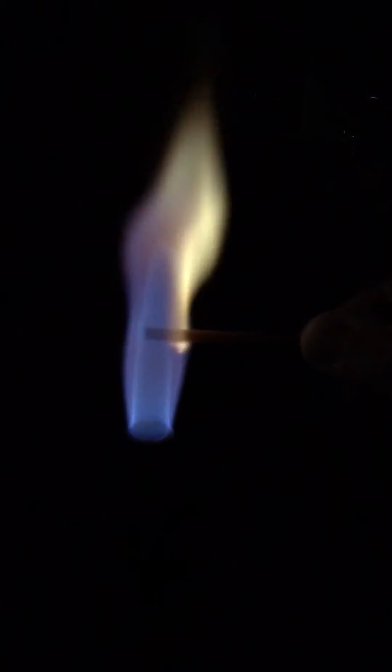I'm going to try another splint — that one didn't have the right coloring to it. Let me get a little closer as well. Here's unknown one again. It's kind of like a yellowish-greenish flame; it's very fleeting, it's at the beginning.